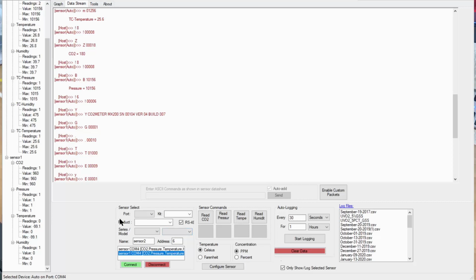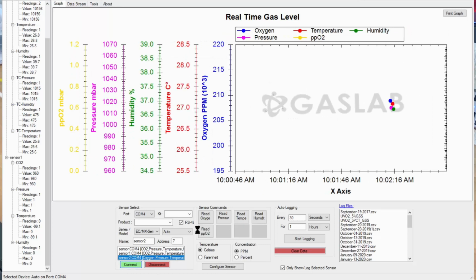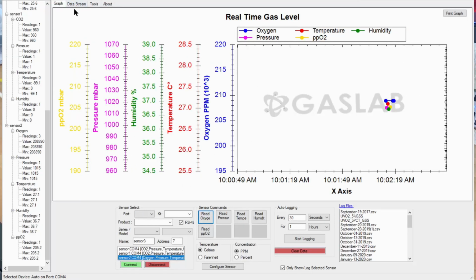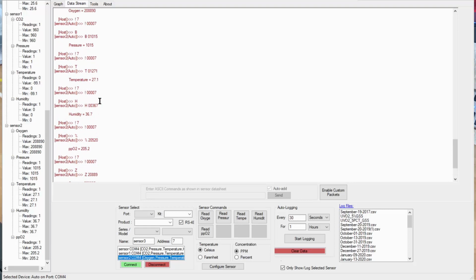So now we have two sensors connected and we got a third to go. So we'll go back to the graphing screen because it's easier to read. And again, we're going to be on port COM 4. We're RS485. We are an EC-MX series sensor, and we are going to be on address 7 this time. And this is an oxygen sensor. So we're going to do a connect. And lo and behold, our oxygen sensor shows up. And we'll read a little oxygen. Again, you'll see in the data stream portion of it, it sent the information down to address 7, was acknowledged as address 7, and we were off to the races.